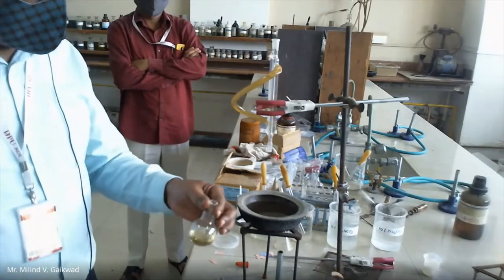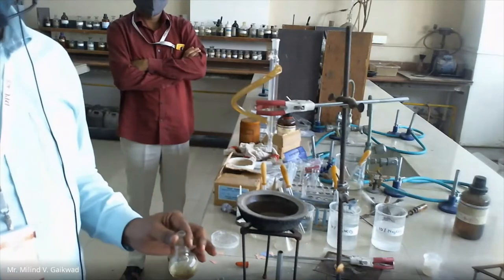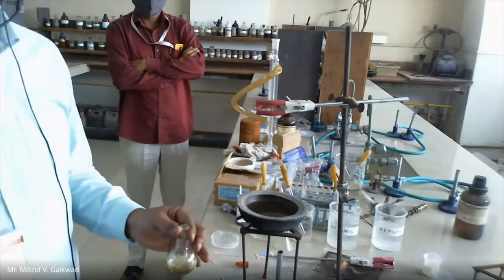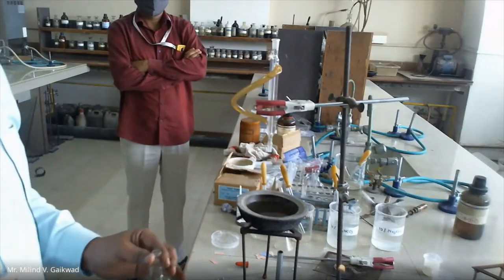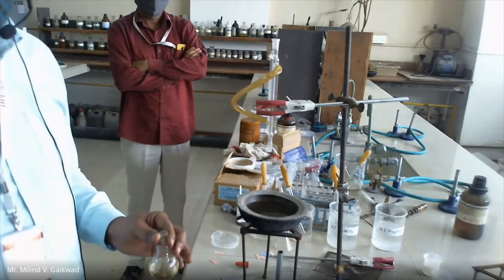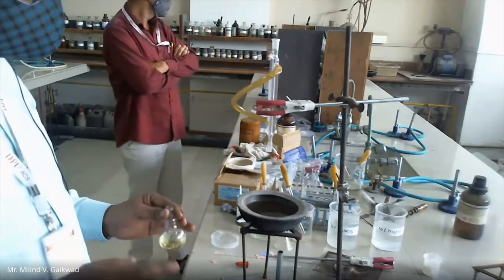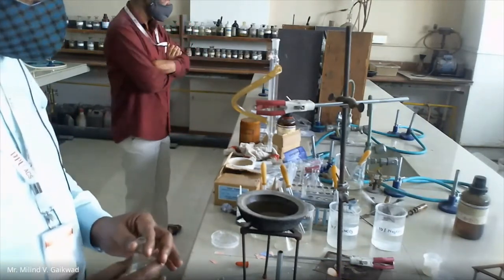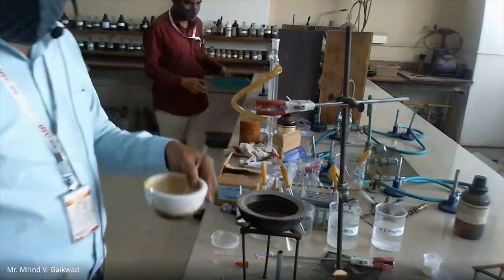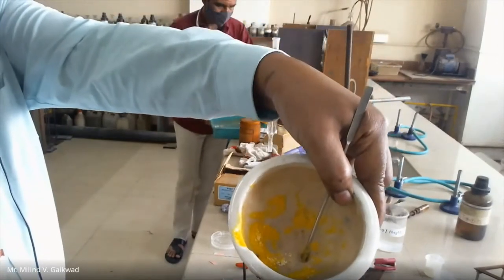Welcome to all. We are discussing organic qualitative analysis. Last time we took a binary mixture — solid plus solid. For that, first we have to see the nature: nature is solid plus solid. Just by physical appearance, you can say that it is solid plus solid.